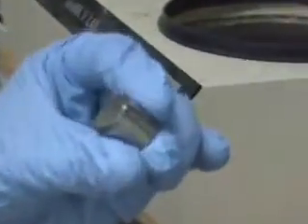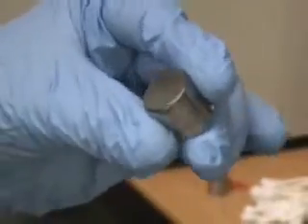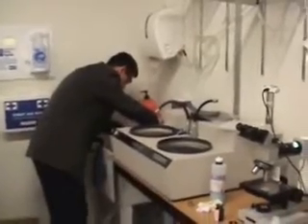The specimen is most probably now just about to be over-etched, and because of that perhaps you will see much more of the darker grains than what you saw in the previous one. Let's try that and see if this is happening or not.